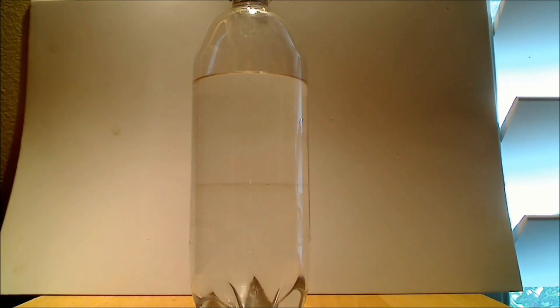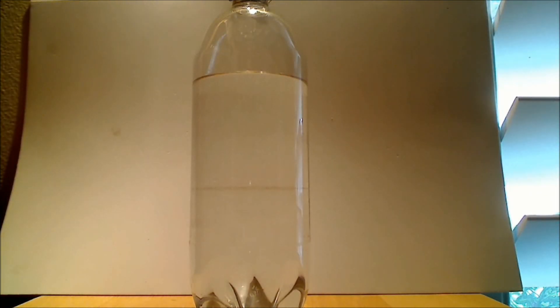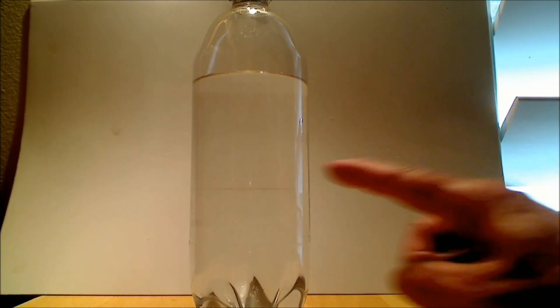And I might be able to show this. Okay, now you can sort of see the phase boundary in the middle there, right about here.